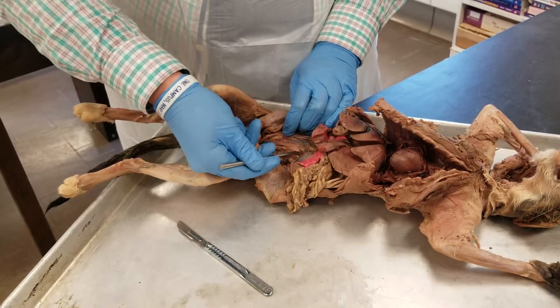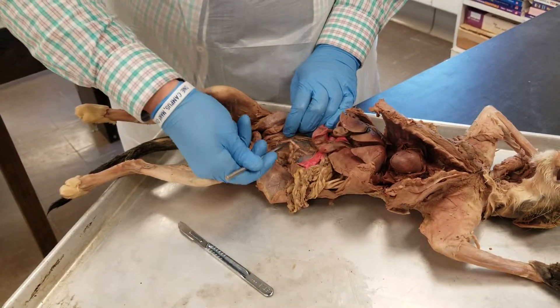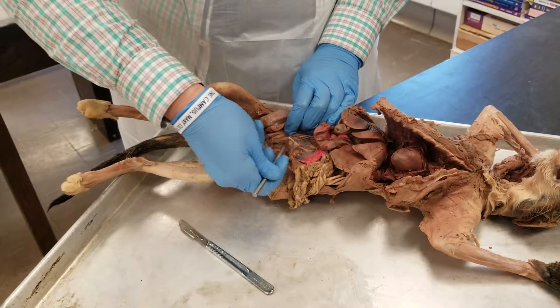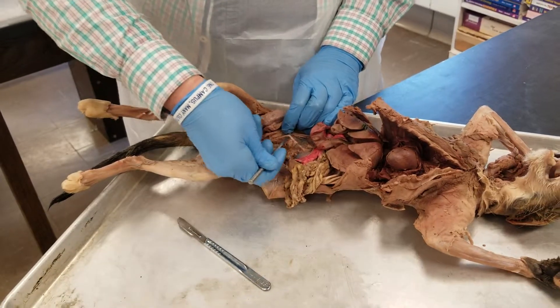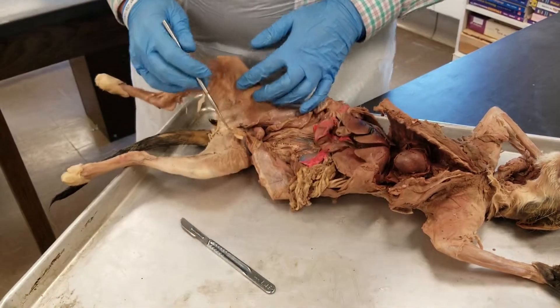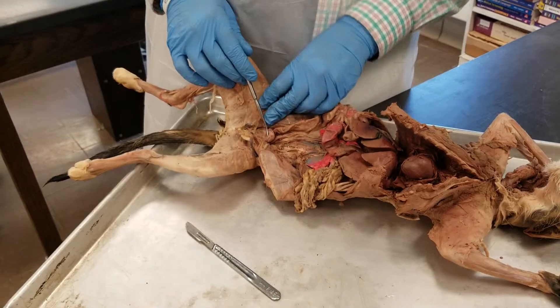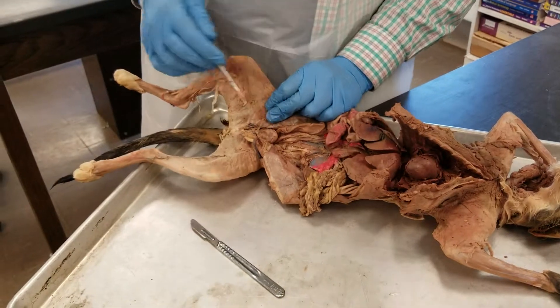This right here is the ureter for the left kidney. Finally, we have the urinary bladder here. And that is everything.